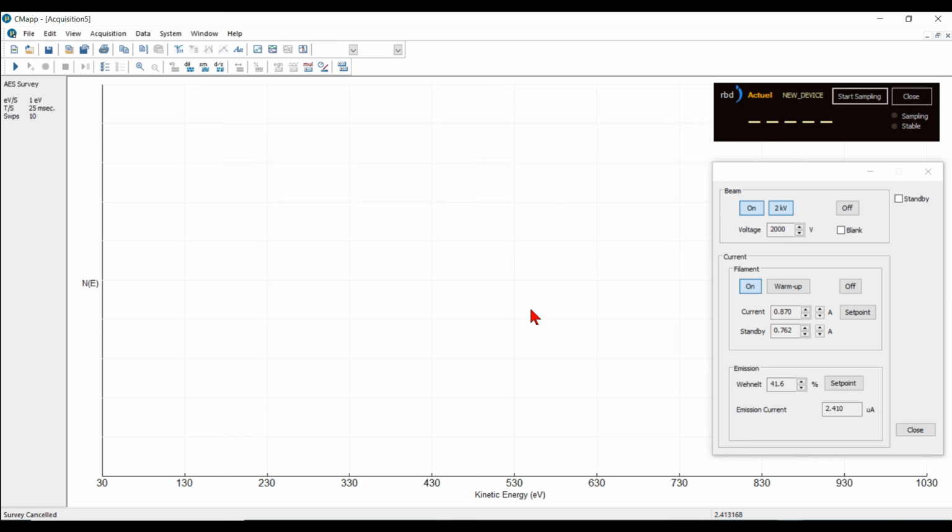What you could do, if you do see charging, is you can try using a lower beam voltage. Like I'm already using 2 kV. That's about as low as you'd want to go probably. And you could lower your target current as well. But charging samples just really do not do very well with Auger, which is why you really need to have semiconductors and conductive samples.